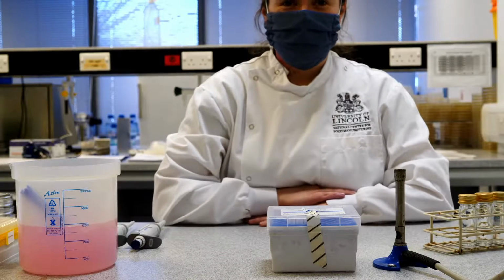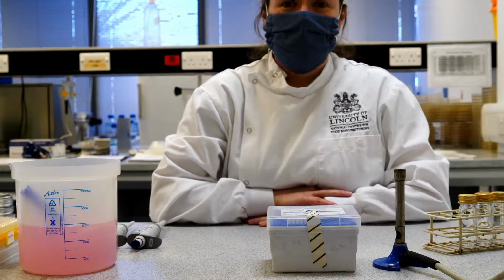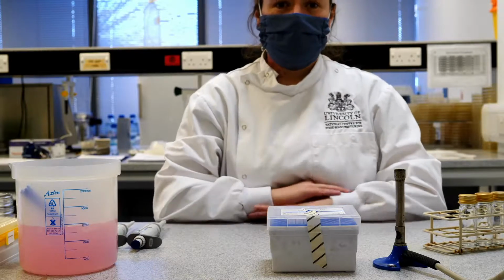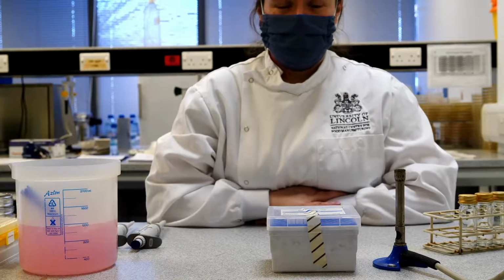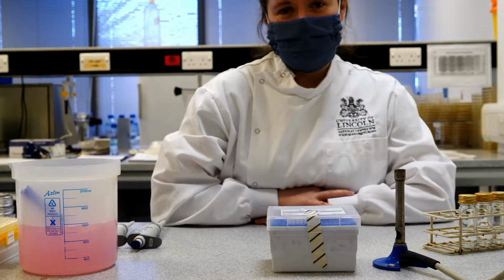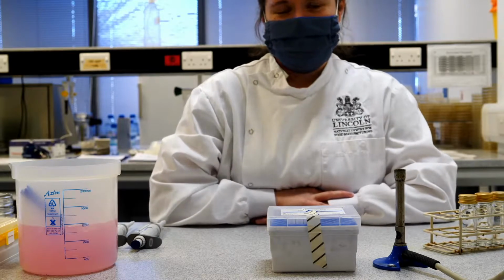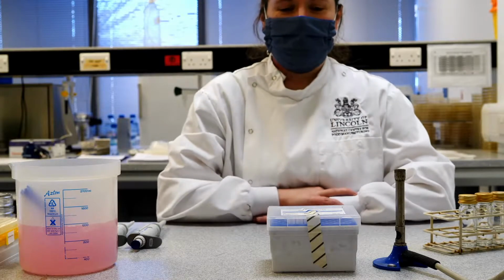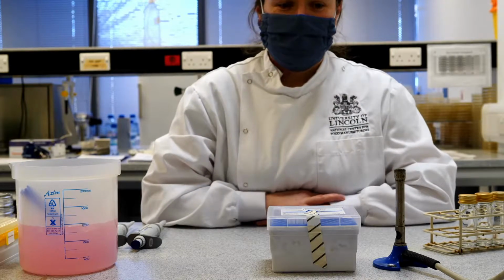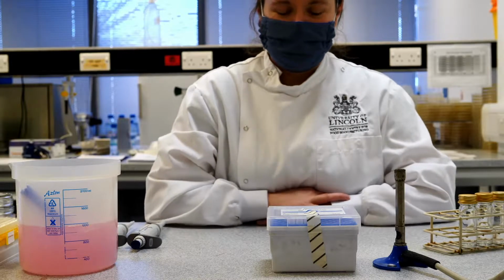Good afternoon, everyone, and welcome to the NCFM Microbiology Lab. What I'm going to be doing today is just running through some of the techniques that we do to carry out food microbiology. I hope you can see me and hear me, and it's very lovely to have you with us, even though I can't see you. I've decided to call myself for today the masked microbiologist, just because that seems like an appropriate term to use for the situation that we're in at the moment.